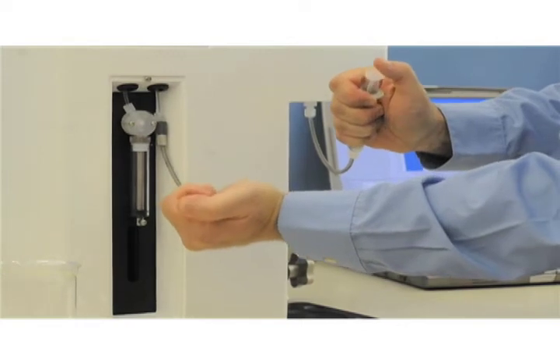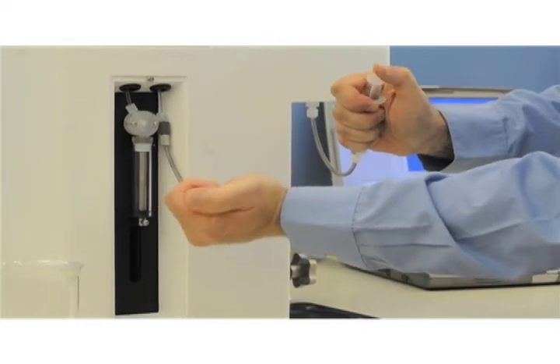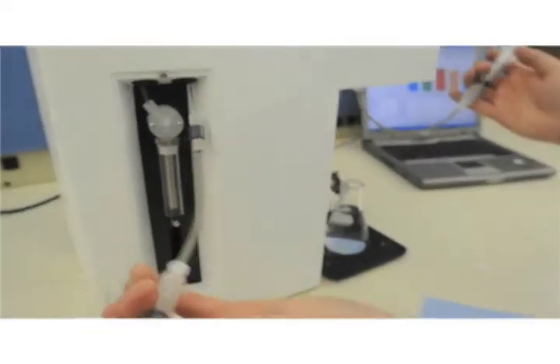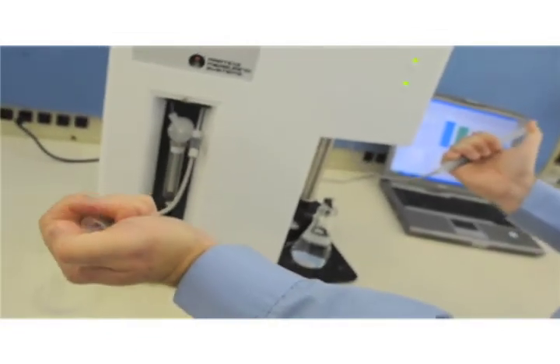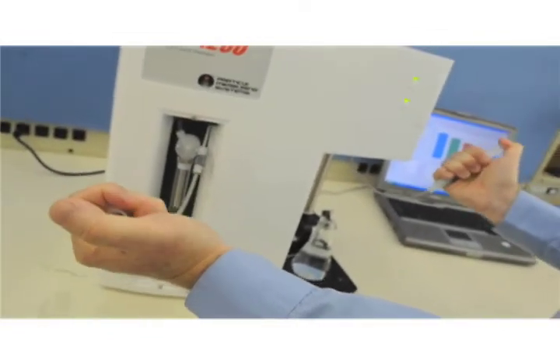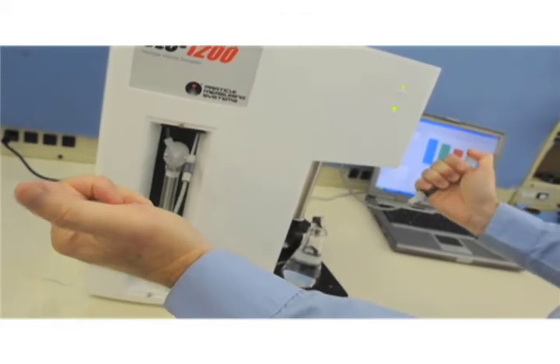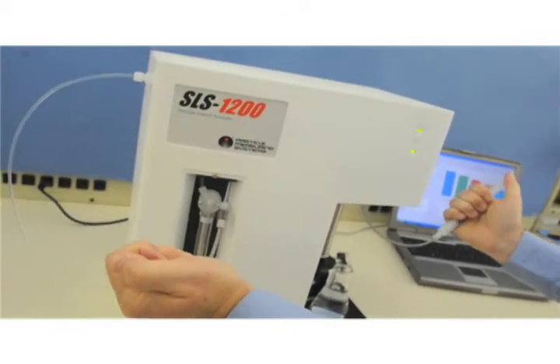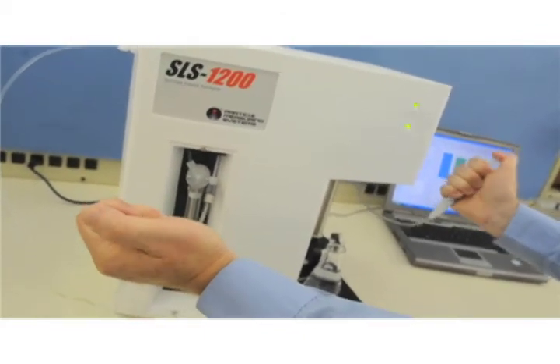If you feel it is necessary, you can leave the cleaning solution in the system for an extended time to allow it to soak the contamination off the capillary surface. Return to forcing the cleaning solution back and forth through the syringes as a final step prior to completion.